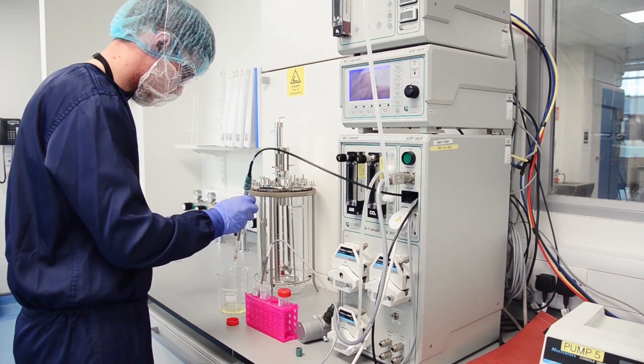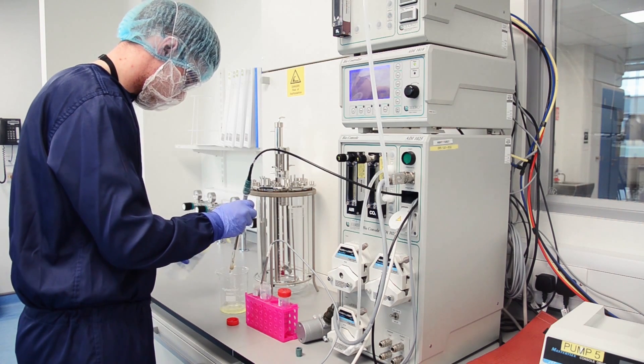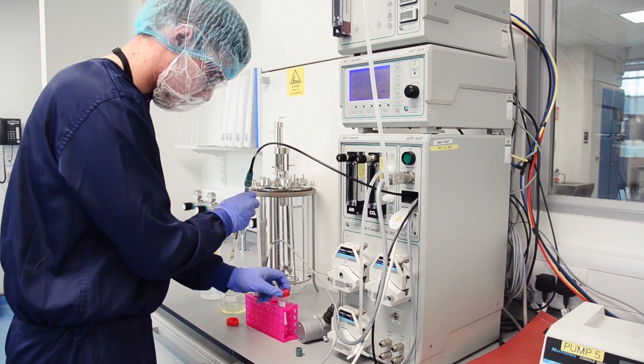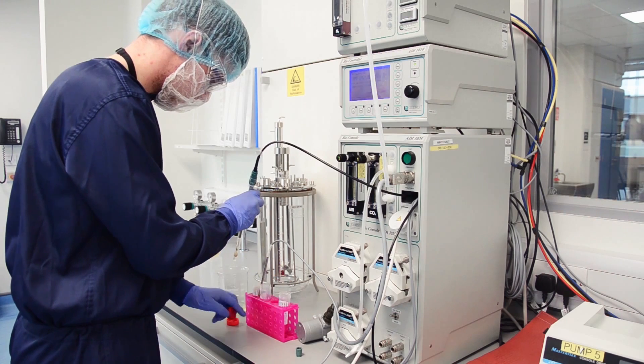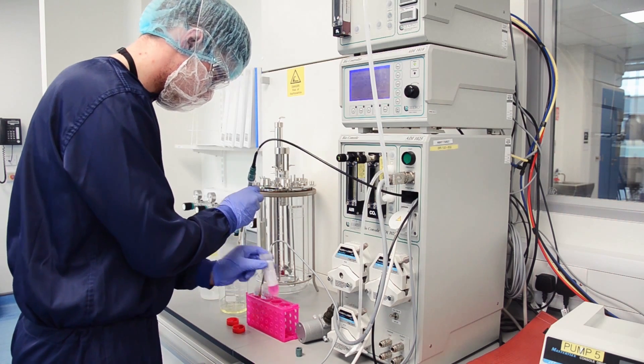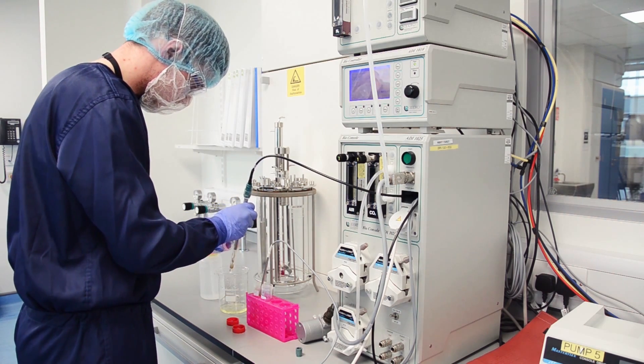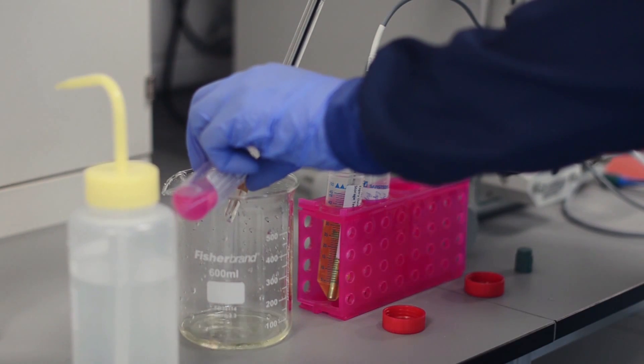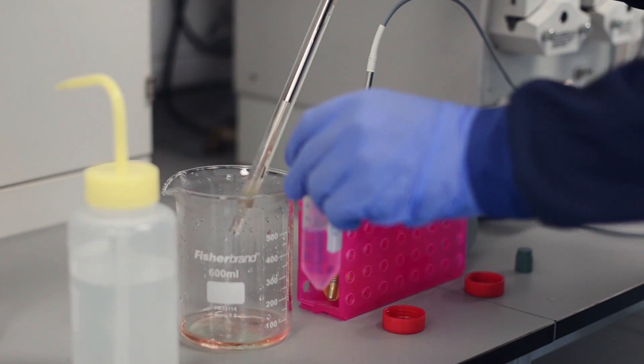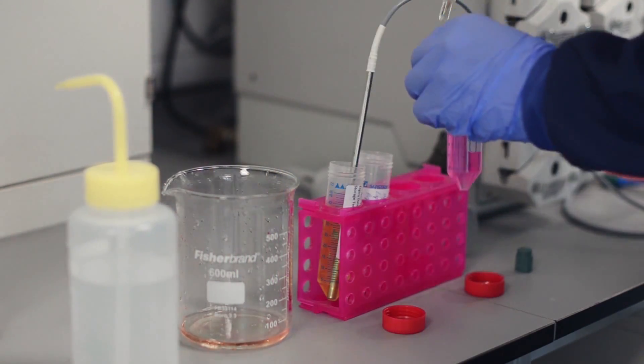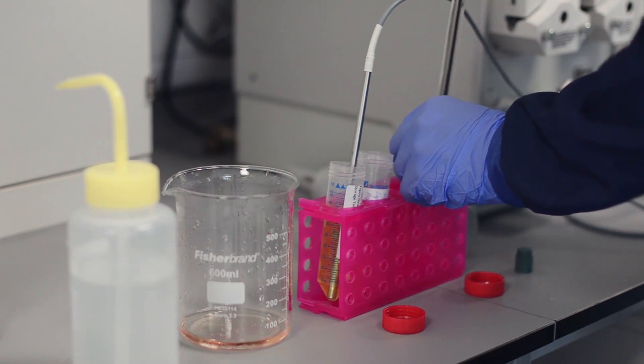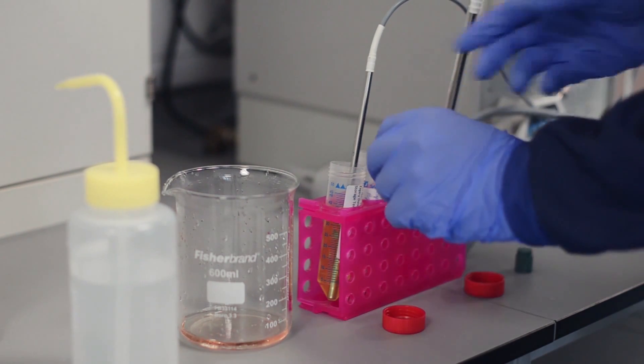The probe is then removed from the buffer, rinsed with deionized water and rinsed with pH buffer 4. It is then inserted into the buffer along with the temperature probe and the controller is set.